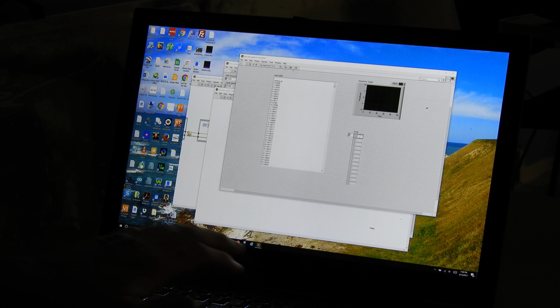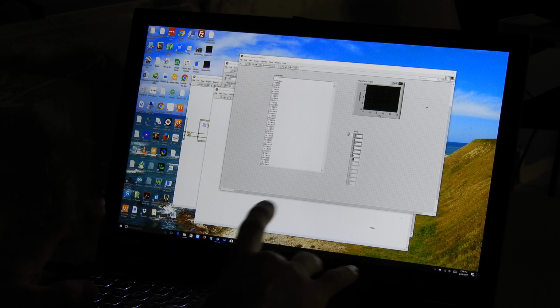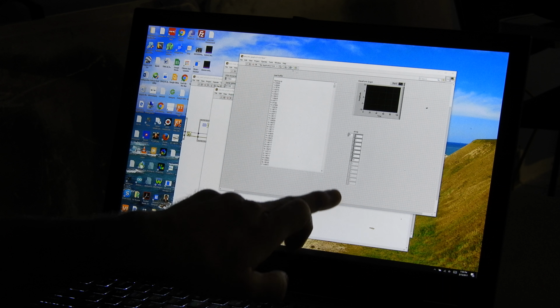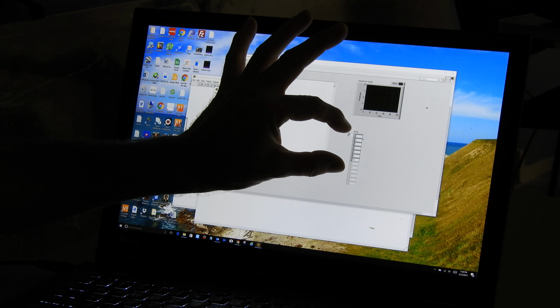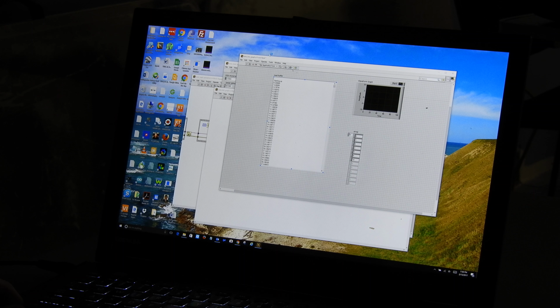But now I'm going to put some values in these numbers. So we're going to say 2, 3, 4, 2, 3, 4, and then I'm going to put in this last number, a 10. Okay, you notice as I'm filling these out that they highlight. These are grayed out down below. That means the length of the array just contains those values right there. And so that is what will actually be passed.